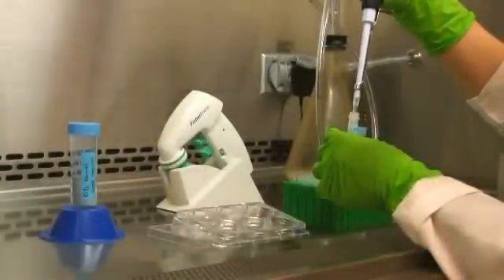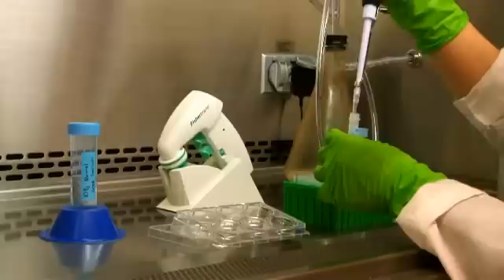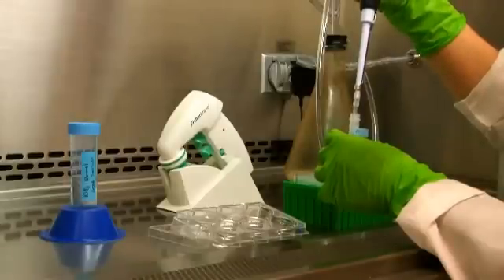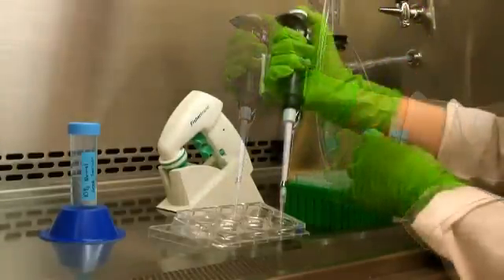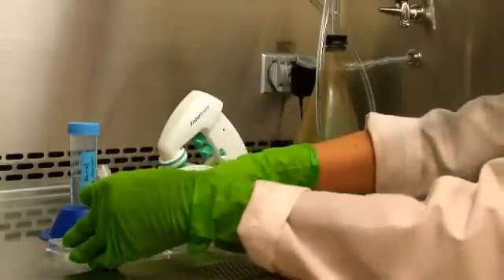Prepare the primary antibody by diluting it in blocking buffer at the recommended dilution specified on the datasheet. Multiple titer dilutions are beneficial to account for variables that may be different in your assay and for achieving the best results.